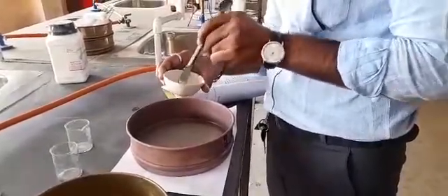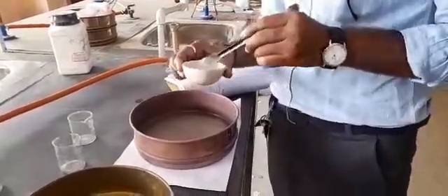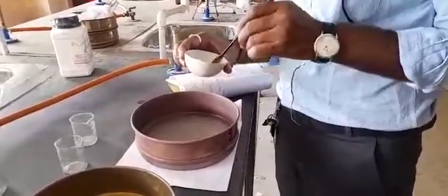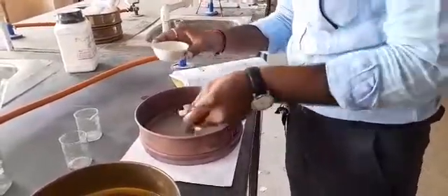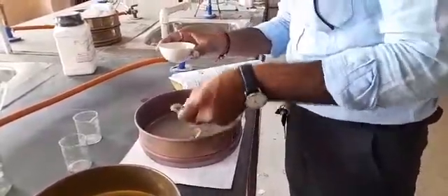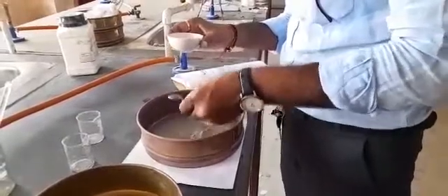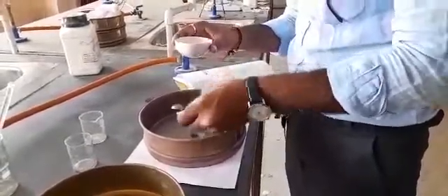Sieve the damp mass using sieve number 8, followed by sieve number 20, to make the final granules. Then remove and collect these granules.